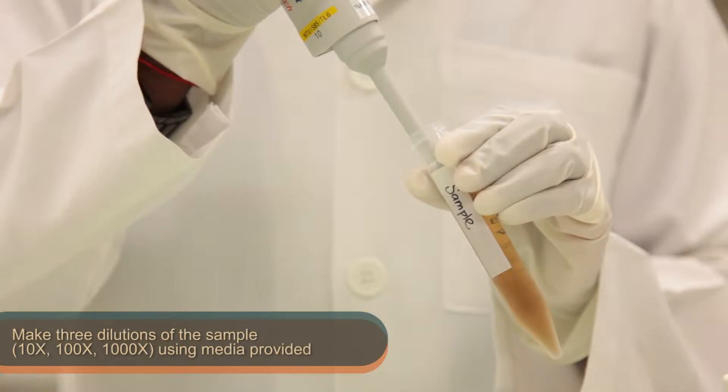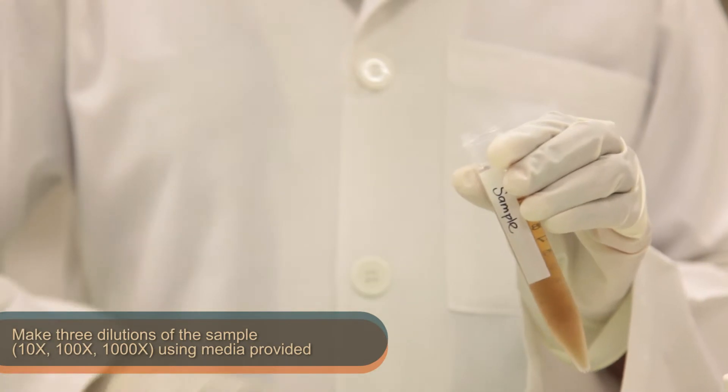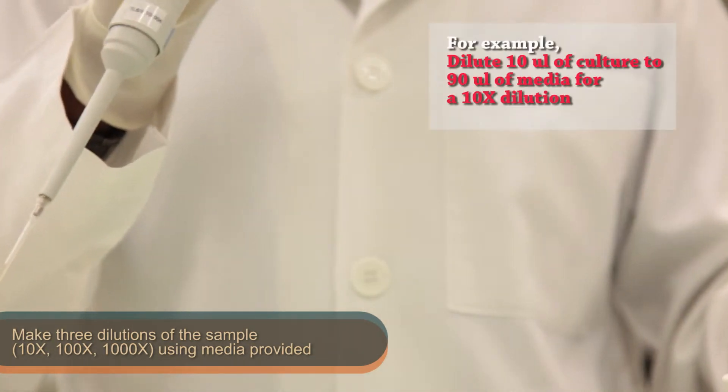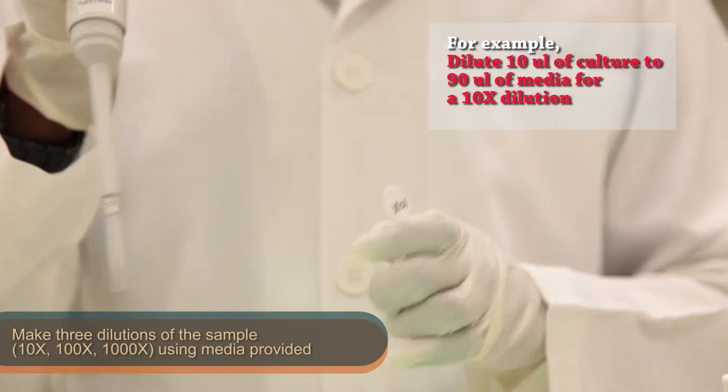With the viable yeast culture sample that is provided, make a 10x, 100x, and 1000x dilution of the sample using the given media.